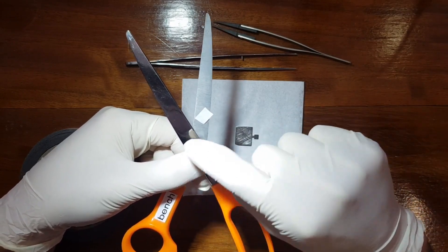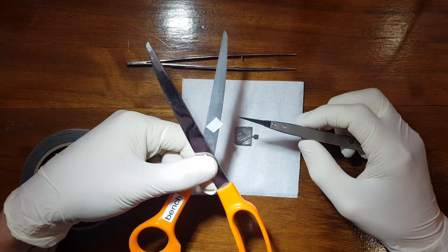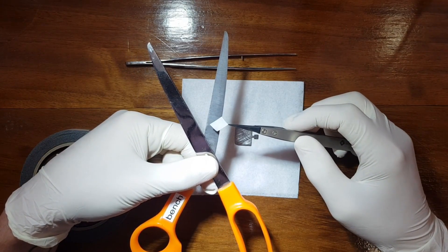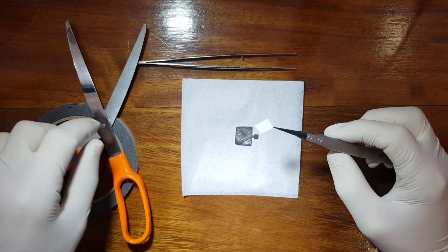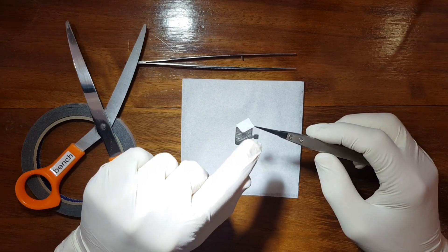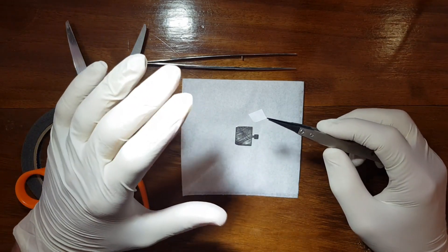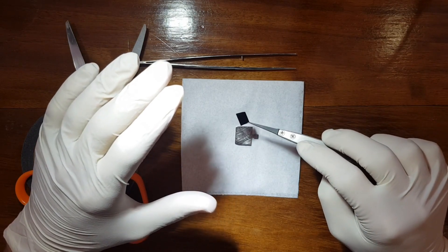We only care about the top layer and that's why there's a protective coating on there. I'm going to use this little tweezer and I like to just touch the surface there. The adhesive keeps it from floating about and there's no wind in the lab so it's not an issue. If I turn it around you can see that's carbon tape, pitch black.